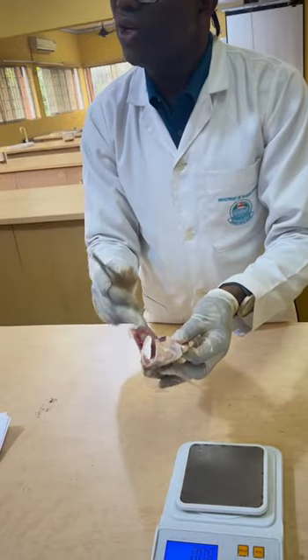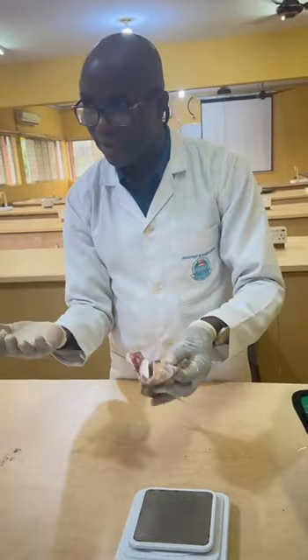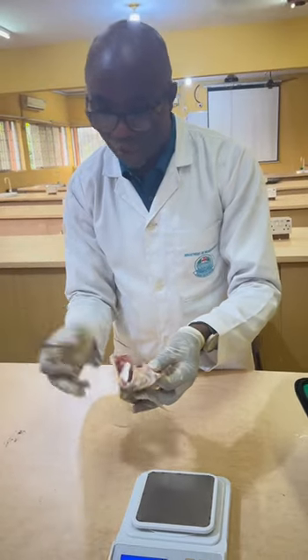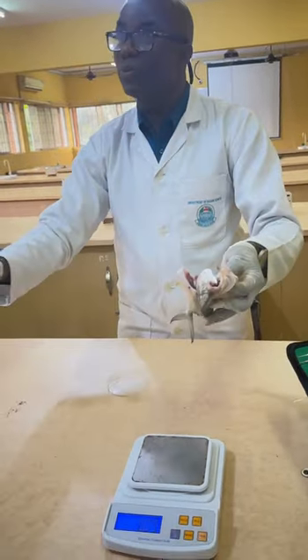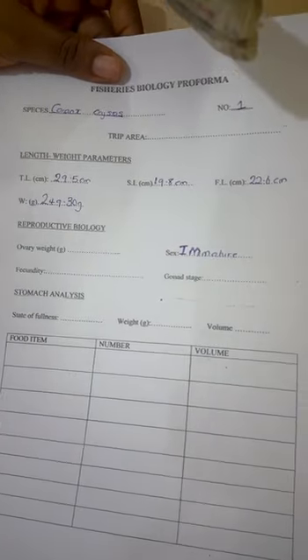Whether it's male or female, for immature, you cannot tell if it's male or female with your naked eye. You can only say immature. It's acceptable to write immature. Since what are you checking it with? You are checking it with your naked eyes. So you can put immature, but when you go back and check literature, you might be able to know that, because it's looking more like immature or resting stage to me.